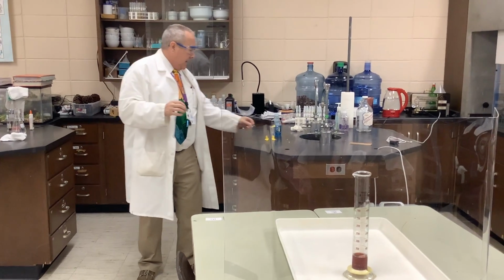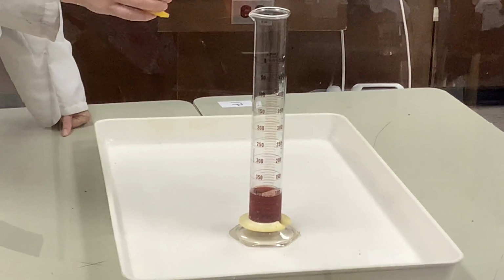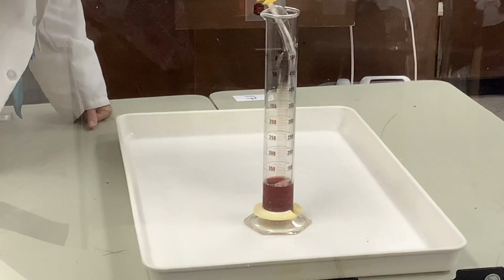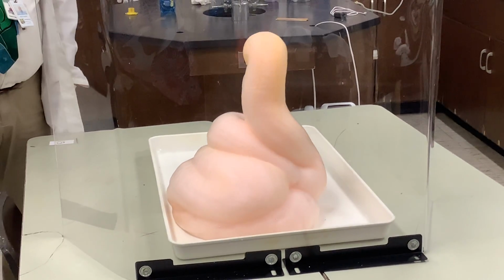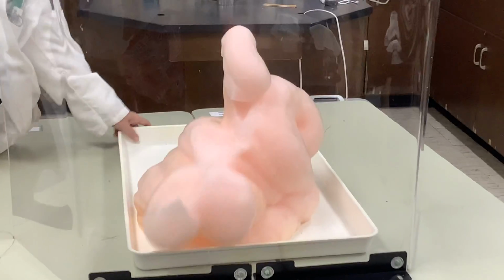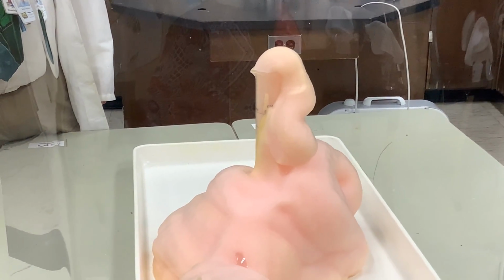I'm going to zoom in on the actual cylinder itself, and on the countdown of 3, I'm going to add this. So 3, 2, 1, and we'll see and watch what happens. And we are going to be spilling out massive amounts of foam, and if you also notice, there's steam rising off of this foam. We're getting some all over. The beauty of this experiment is it's a little bit of a mess, but the cleanup is great because you are cleaning up with soap and water.